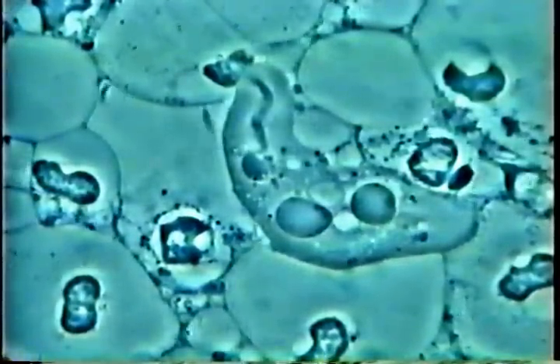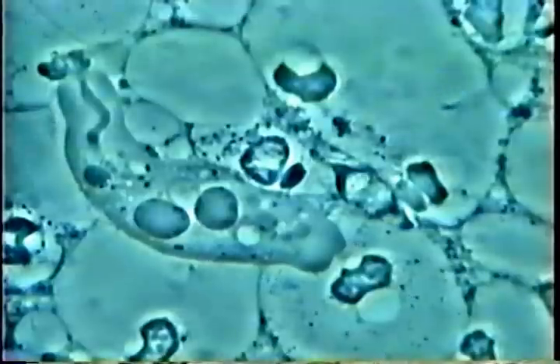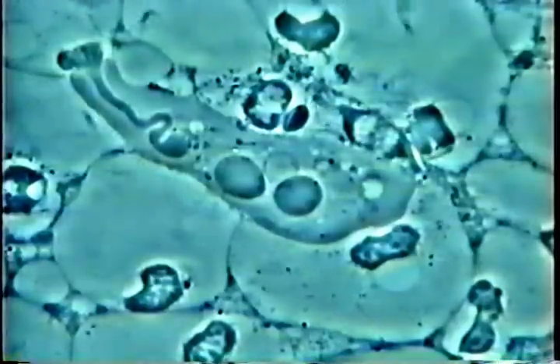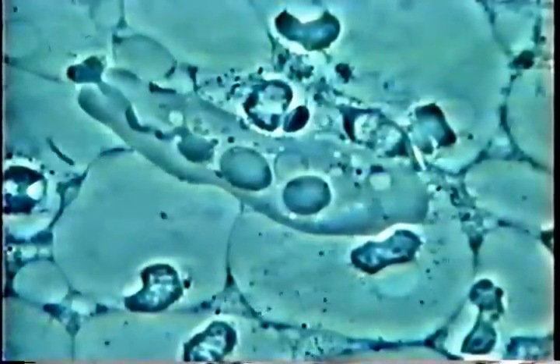It has fed on one, two, and now a third one is being phagocytized. In typical periodontal disease, you have bacteria — moving bacteria like we see some here — and your immune system responds to the aggression of either the bacteria or something causing gum problems. White cells come in to help resolve the situation. At the beginning, if this is gingivitis, it can be corrected. But if you encounter the parasite, the animal parasite Entamoeba gingivalis, this amoeba will feed on your white cells.